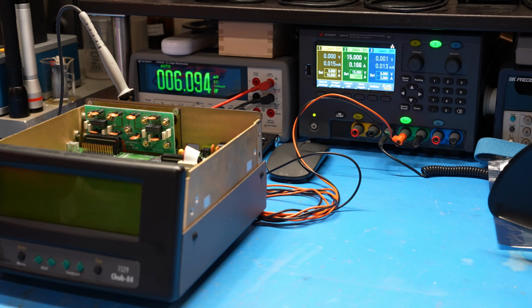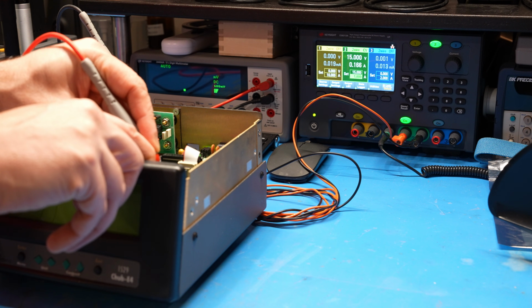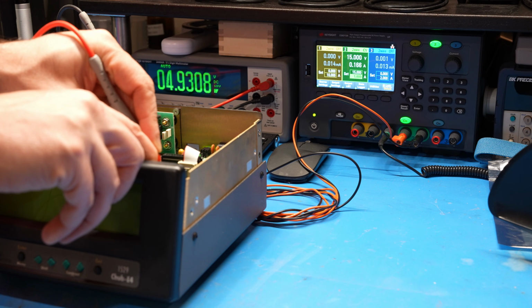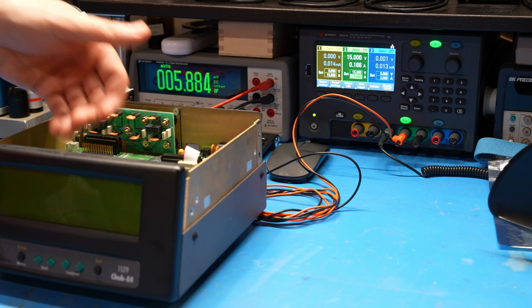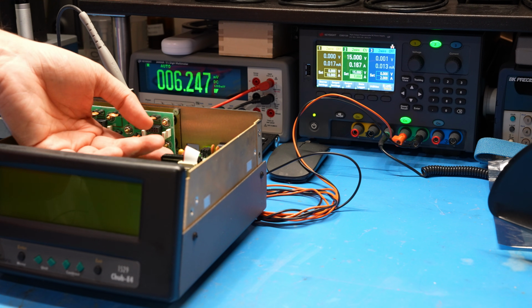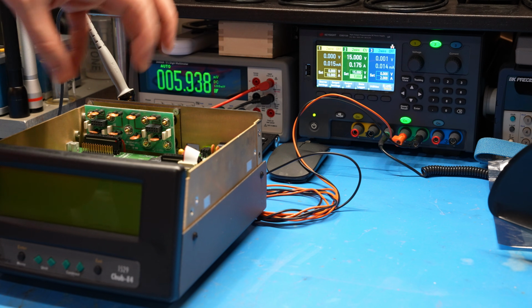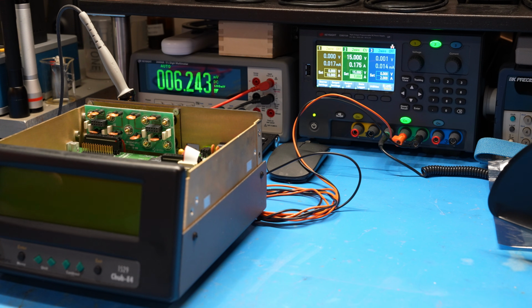So something's definitely changed. Let's check the power supply here. Let's see if it is producing the right power supply voltage. And do we have the right voltage? There it is, 4.93 volts. Okay, so the DC-DC converter is definitely working. Something certainly has improved. I don't feel anything getting warm in here, which is a good sign. But let's take a closer look and see what the architecture is to the processor, and also check around to see if there is any activity, digital activity on this board, because certainly nothing on display.